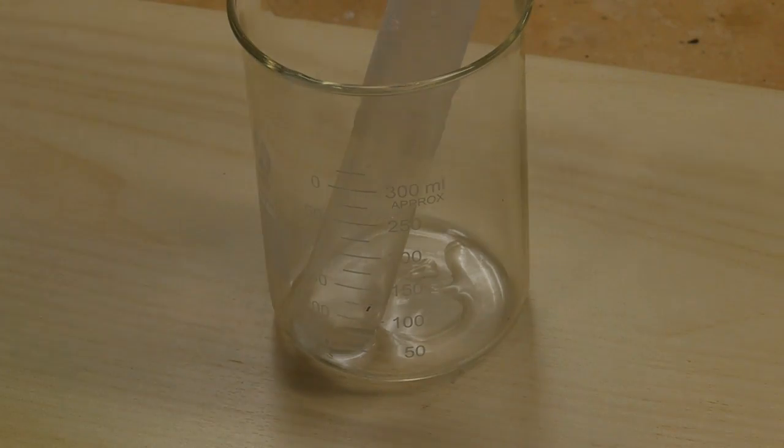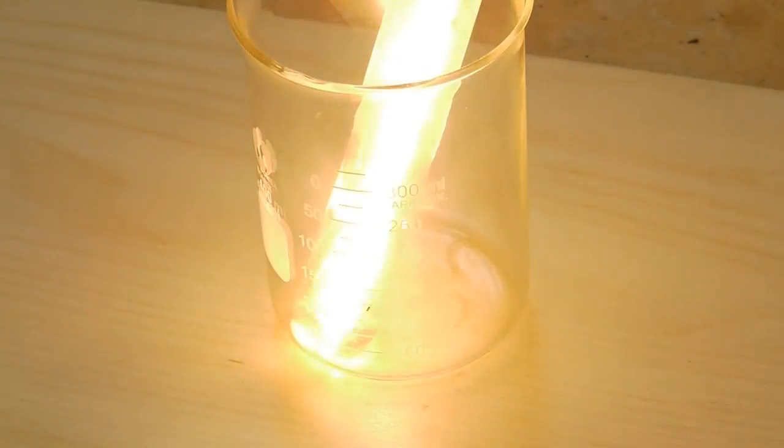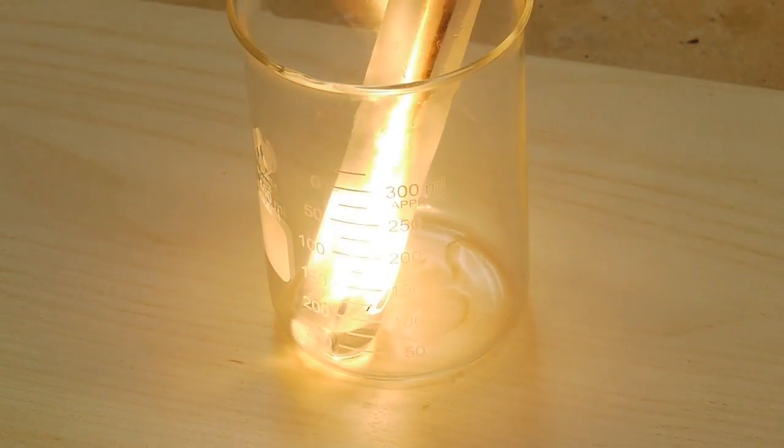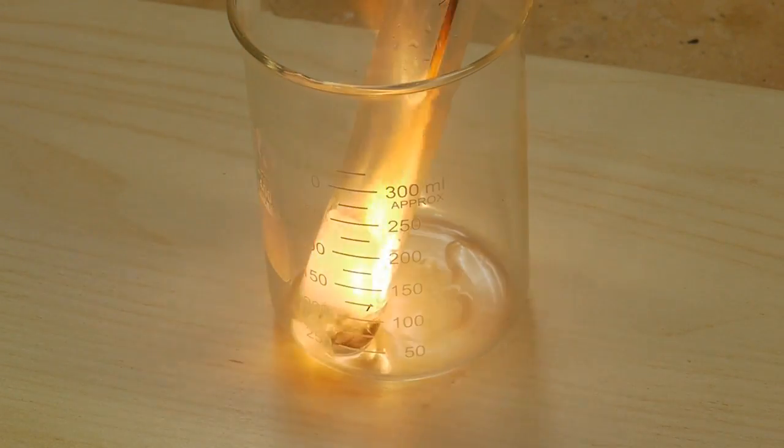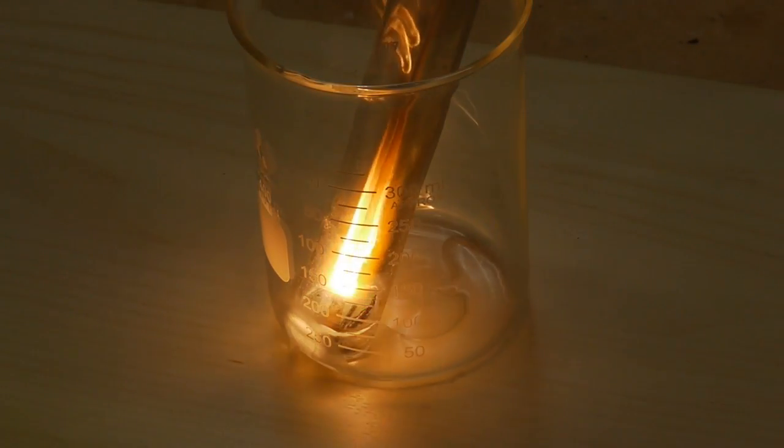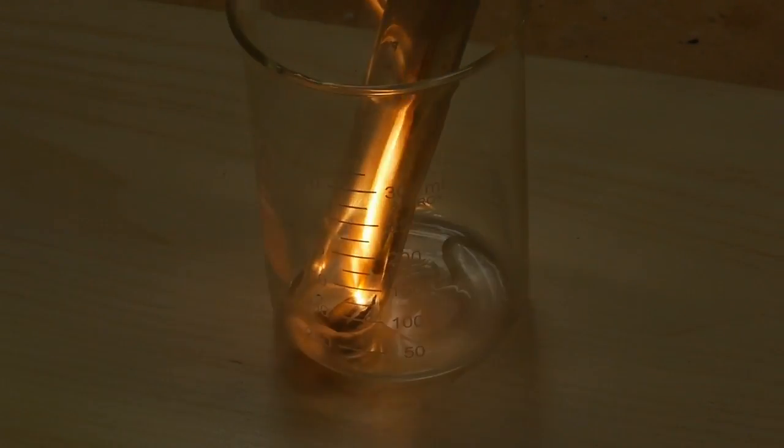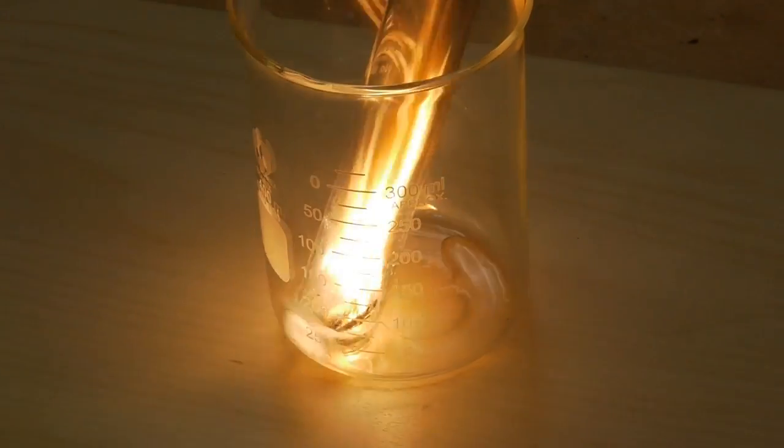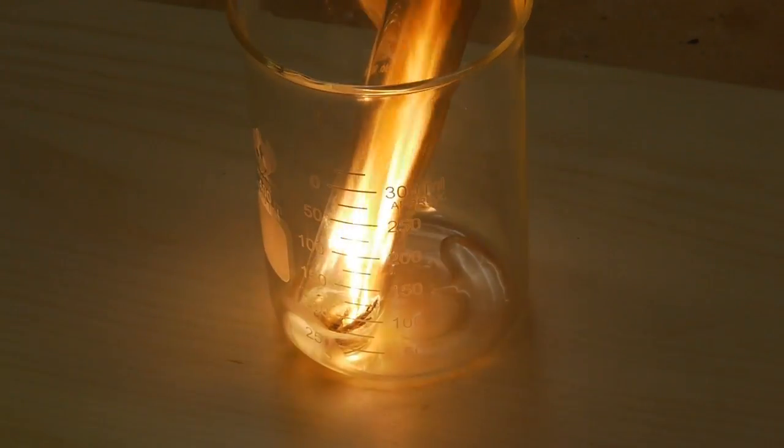Let's do another one. The heat from the flame causes the nitrous oxide to decompose into nitrogen and oxygen, and that additional oxygen causes the flame to burn even hotter, so there's a bit of a positive feedback loop.